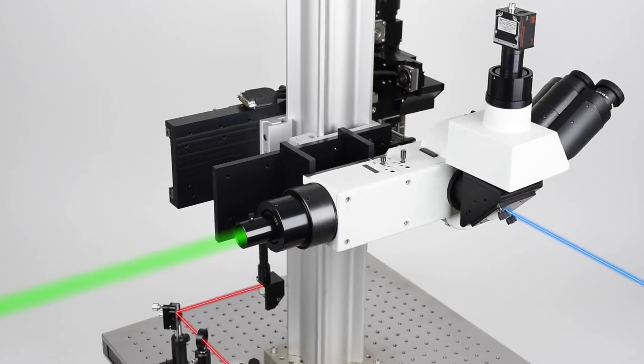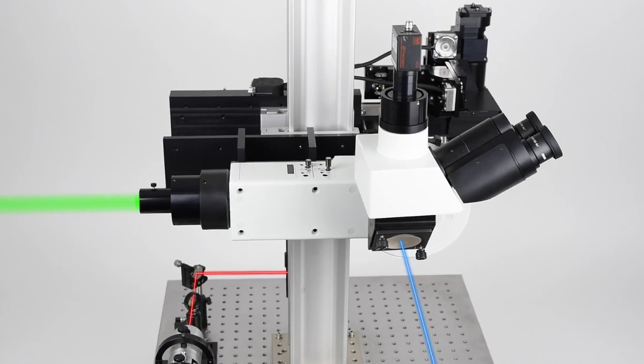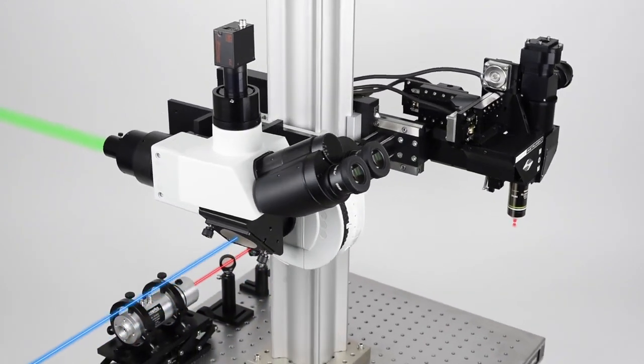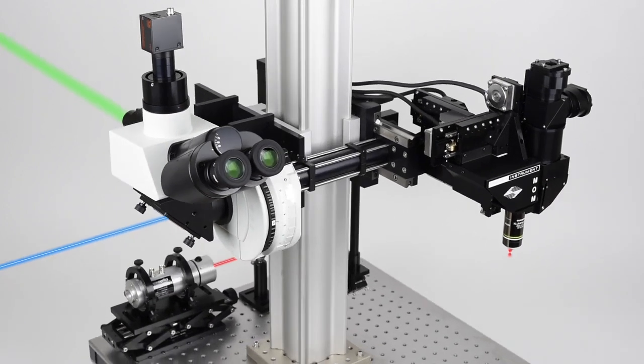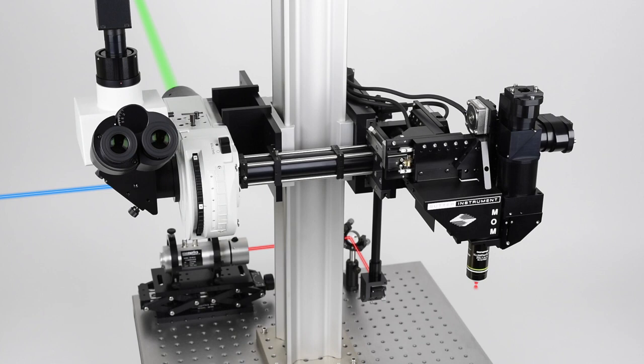Alternatively, the vertical illuminator can be removed altogether for direct beam access to the relay optics that can direct a beam to and from the sample. And finally, this path can be modified as a secondary detector pathway to include a range of other detector types, such as IR cameras and spectral detectors, for example.